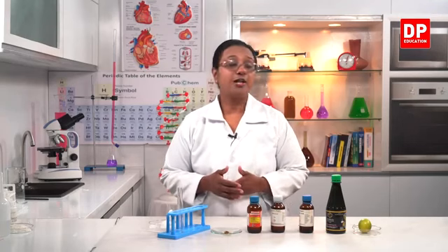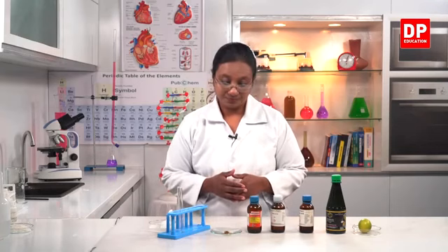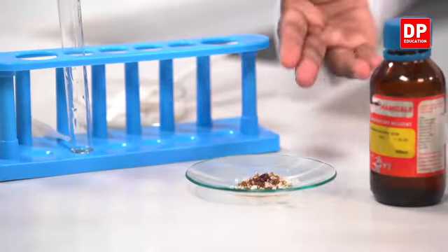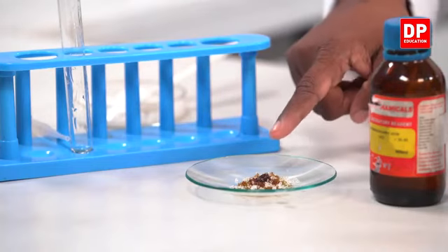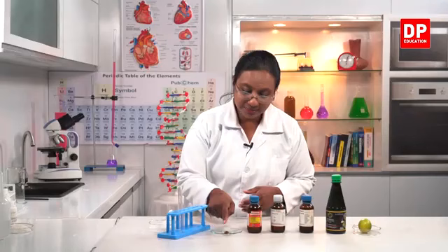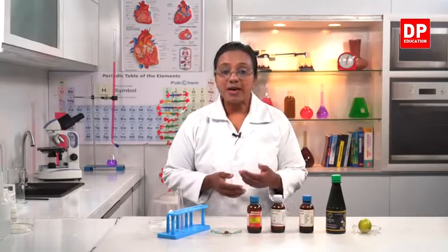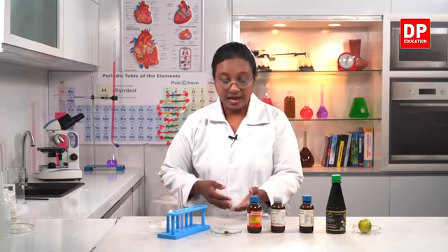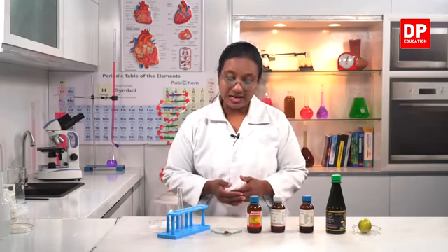And you all know the color of carbon. So we'll see where the carbon is produced here. Can you all observe the color change there? Little by little in the middle, it's becoming darker and almost turning into black color. Can you all see, students, in the middle, the formation of black color? That is because the water is absorbed by concentrated sulfuric acid, and only the carbon will remain. It takes a little time.